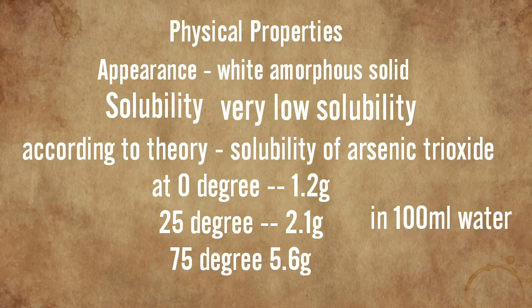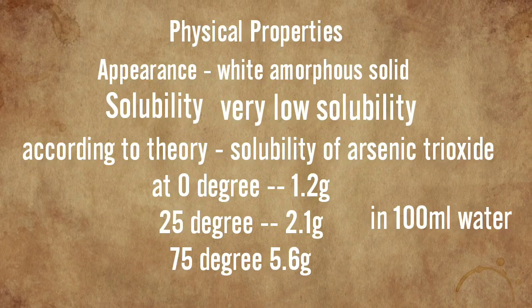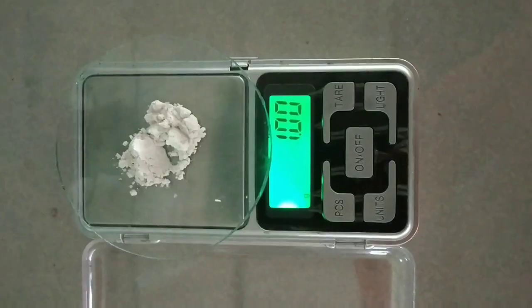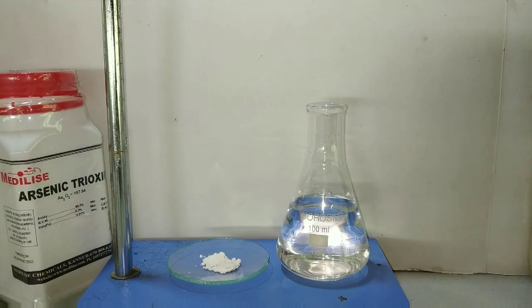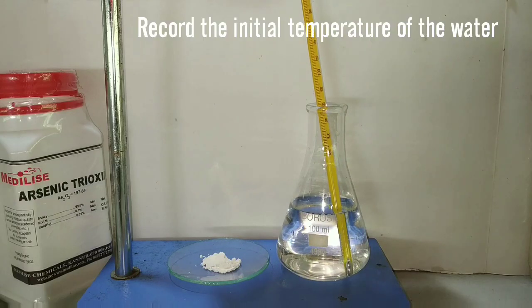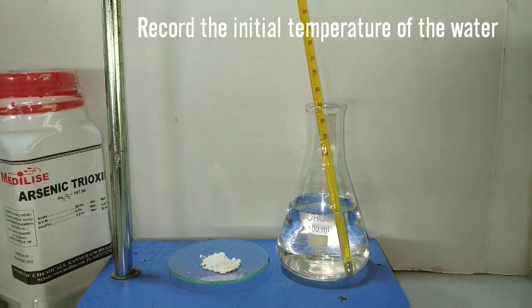Here we are going to test the solubility of arsenic trioxide. I have weighed out one gram of arsenic trioxide. Now I will be trying to dissolve this arsenic trioxide in hundred milliliters of water.